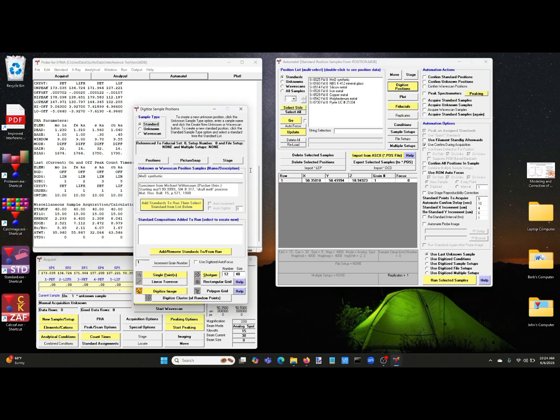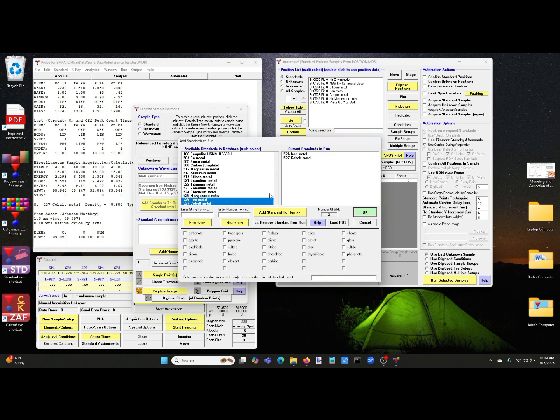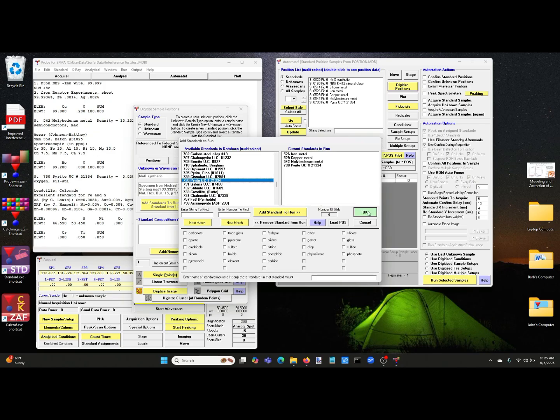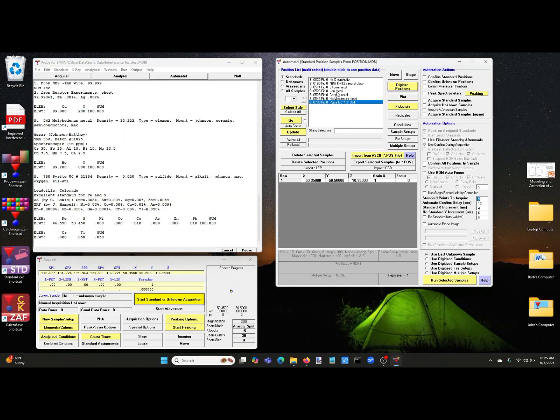So let's start by adding some standards to the run. We could select pure elements mostly. So let's go ahead and add in iron. Oops, not cobalt. Well, it doesn't hurt. Copper and molybdenum. And for sulfur, we will choose the natural pyrite from UC Berkeley. All right, so now we have our standards, and as you can see here, we've already digitized points for them, so they're ready to go. And we run them just as we normally would, confirm and acquire.